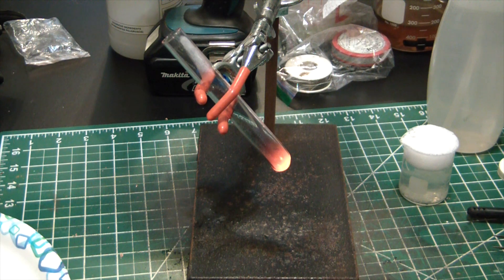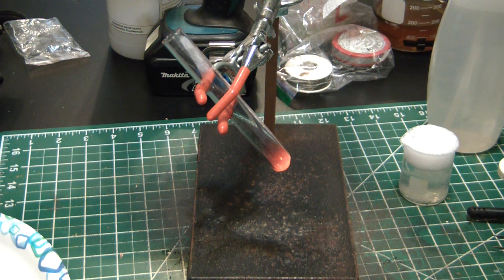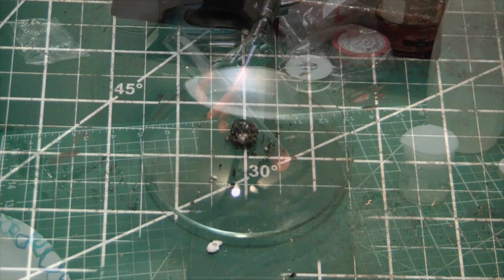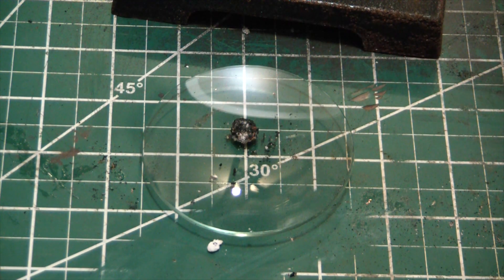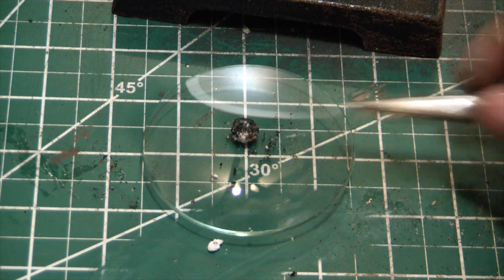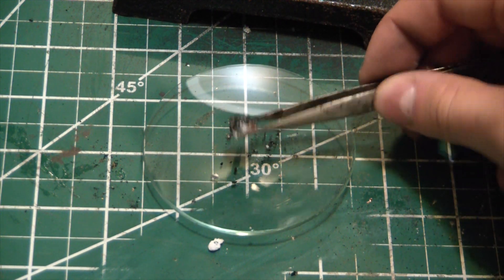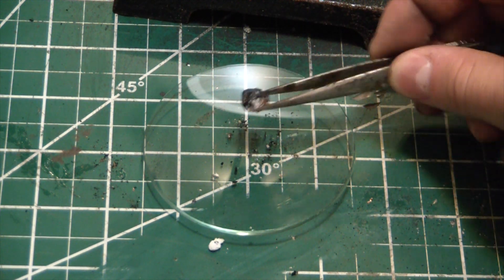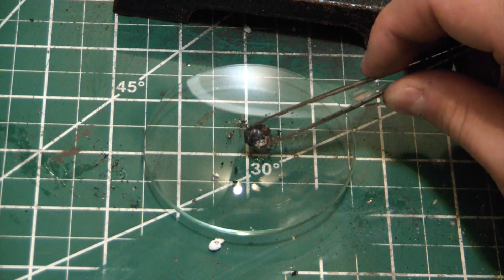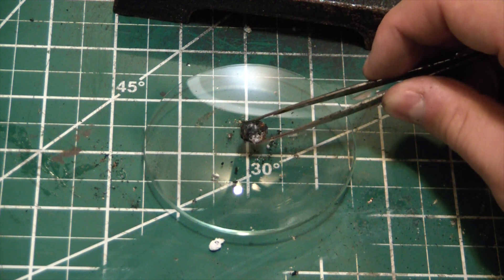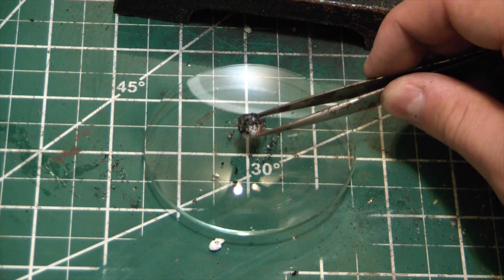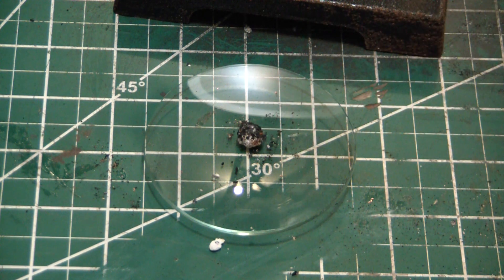Not sure why it popped like that this time. So this is what just came out of the test tube. I think it's one big chunk of calcium carbide. Pretty freaking cool.